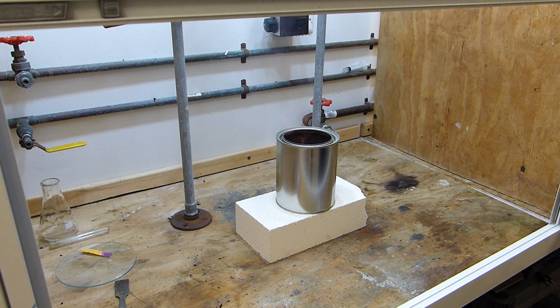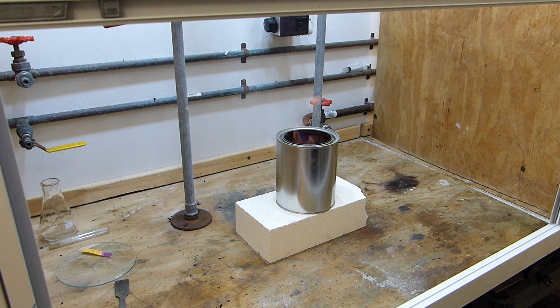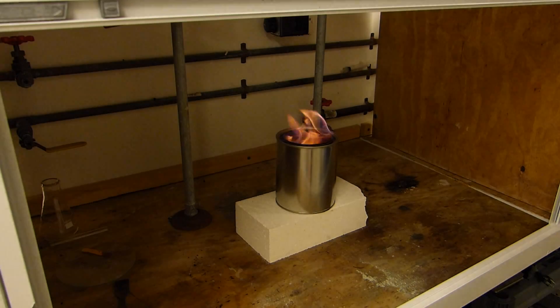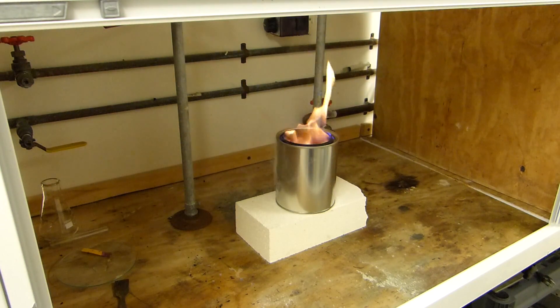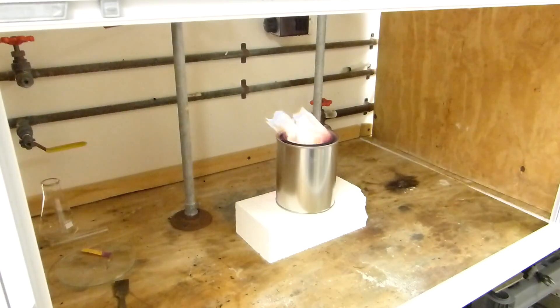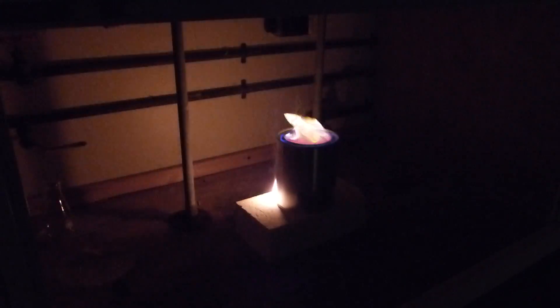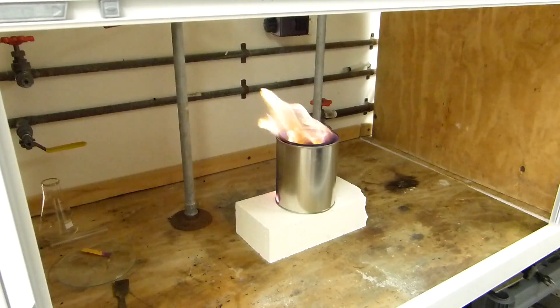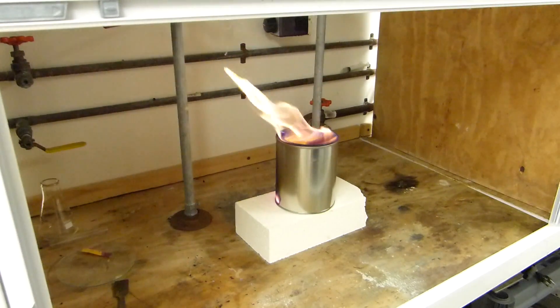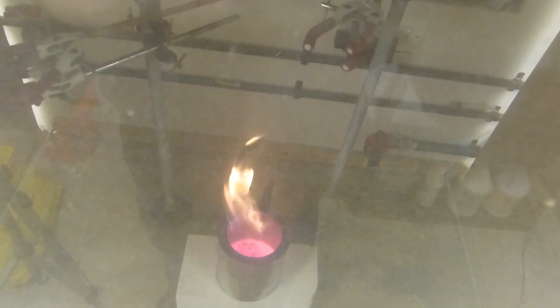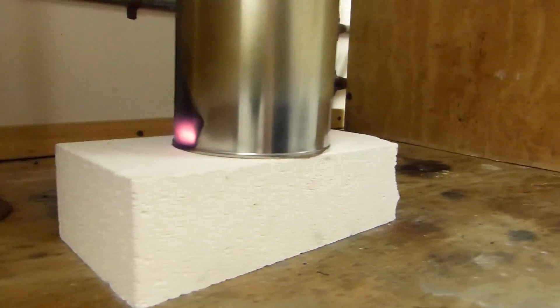I think that'll do it. You can see the blue sulfur flames. I'll actually turn the light off. That'd be kind of cool. You can see the paint starting to burn off the can. It's getting awfully hot.